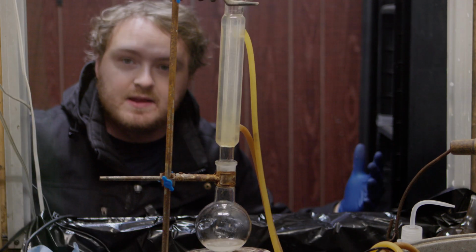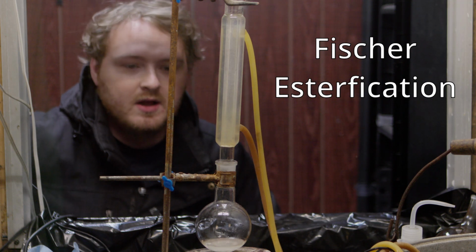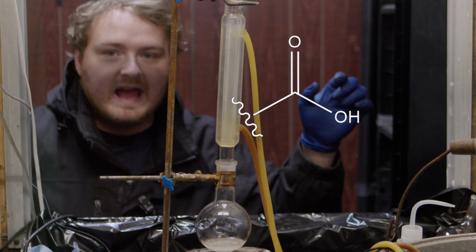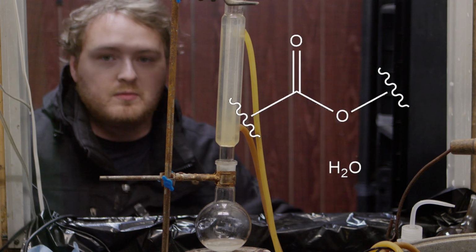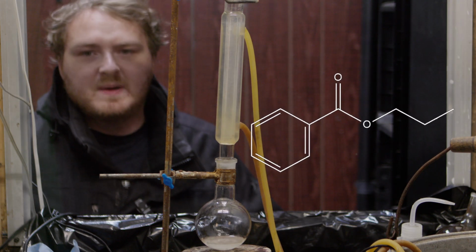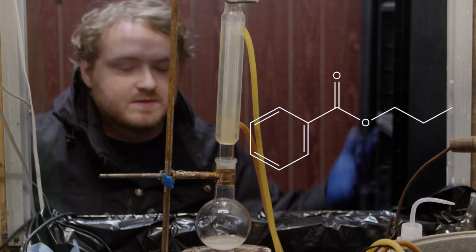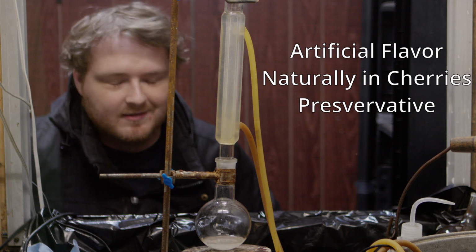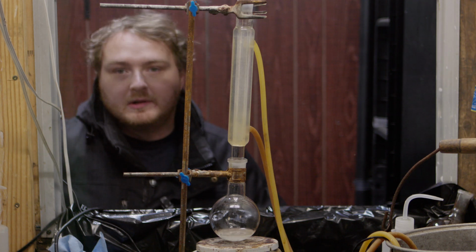Now, essentially what's happening here is a reaction called a Fischer esterification. We've done many of these on the channel before, but essentially what happens with the Fischer esterification is a carboxylic acid group and an alcohol group link together to form an ester. In this case, the ester that's being formed is propyl benzoate. Propyl benzoate is a naturally occurring ester that gives certain fruits and things their smells. Here's a list of some things. It's got some other applications, but really we're just in it for the smell. So we're going to leave this for 8 hours to make our final product, and then we'll have to clean it up a little bit.